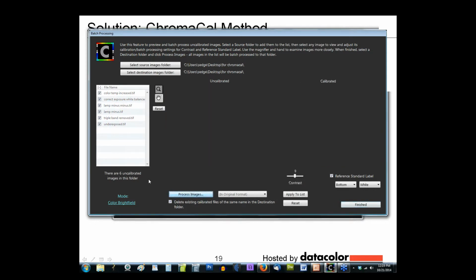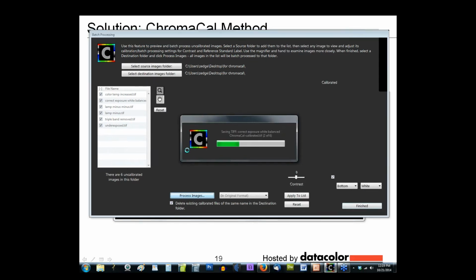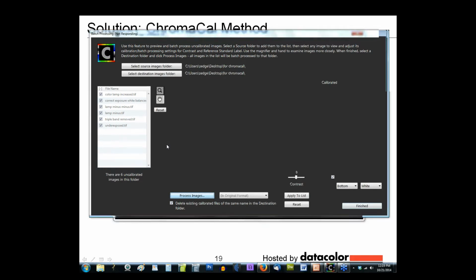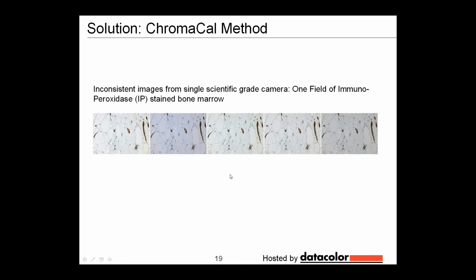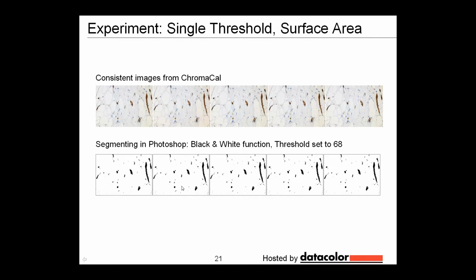So I'm going to go ahead and process those images, and rather than wait for this to complete, which doesn't really take very long, back to the slide presentation, and here are the images that resulted from that process. You can see that the first image here has been corrected, second image, and so on have been processed in ChromaCal, and that these are very consistent. But I don't know if I believe that, so let's do an experiment.